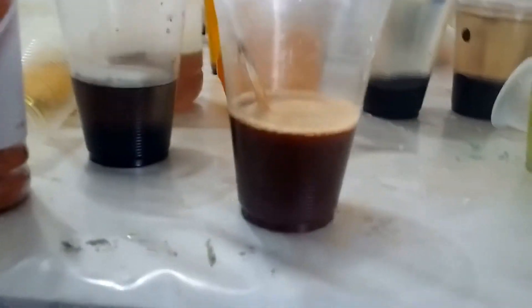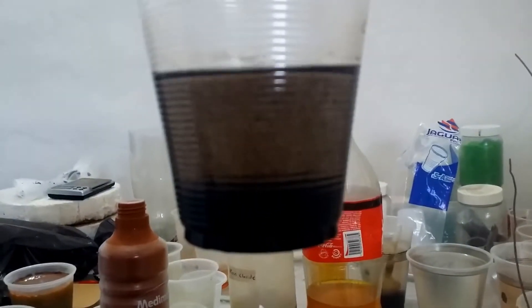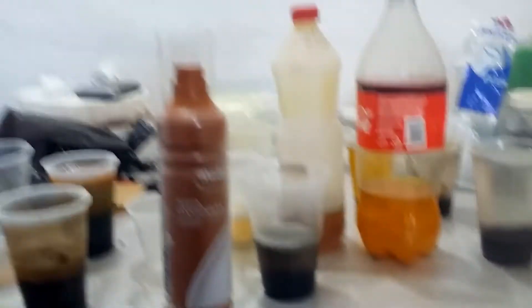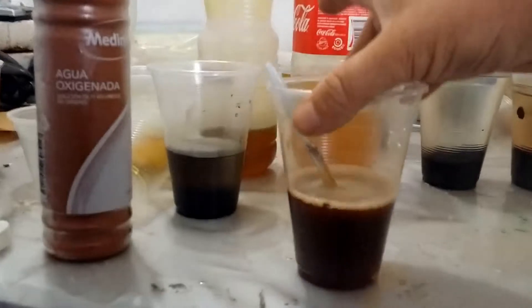From this camera angle you can hardly see the difference in color. This one is quite jet black and it's already settling out — you can see it in the light there, settling out. This other one, maybe in the light you can see — not very well — but it's a pretty deep red, iron(III) oxide. Maybe with the spoon there you can see that deep red color.